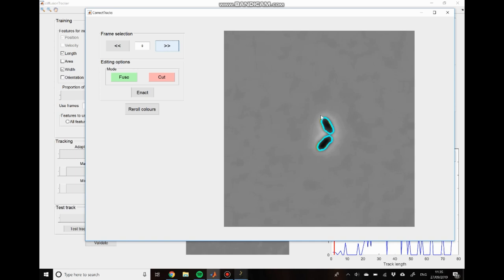So you can see that we have these cyan cells highlighted. That indicates that we're at the end of a track for these cells. And then if we move to the next frame, you can see that we have this orange cell highlighted. That indicates that we're at the start of a track for another cell. So basically we have one track that stops too early and another that starts too late. So we want to fuse these two together.